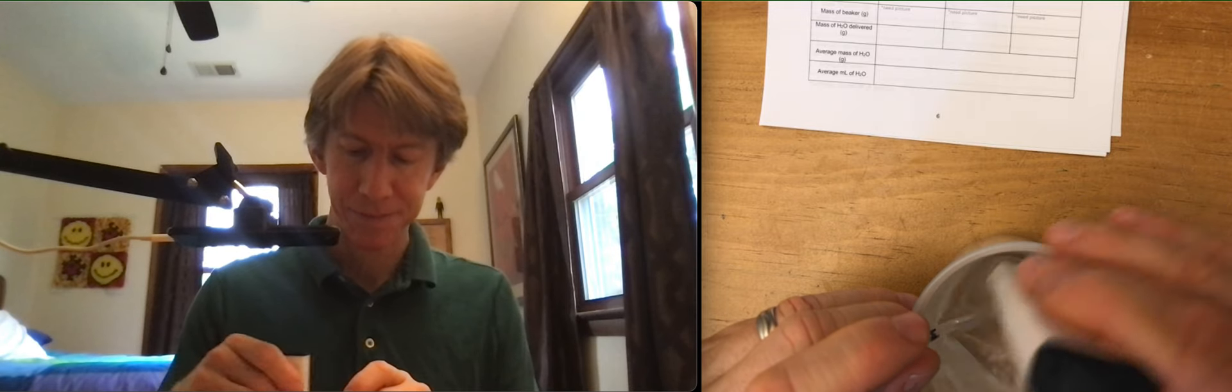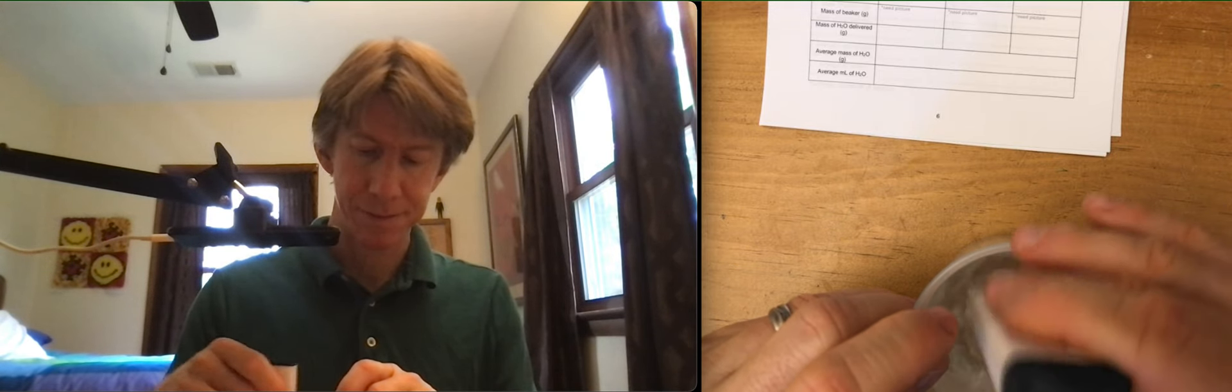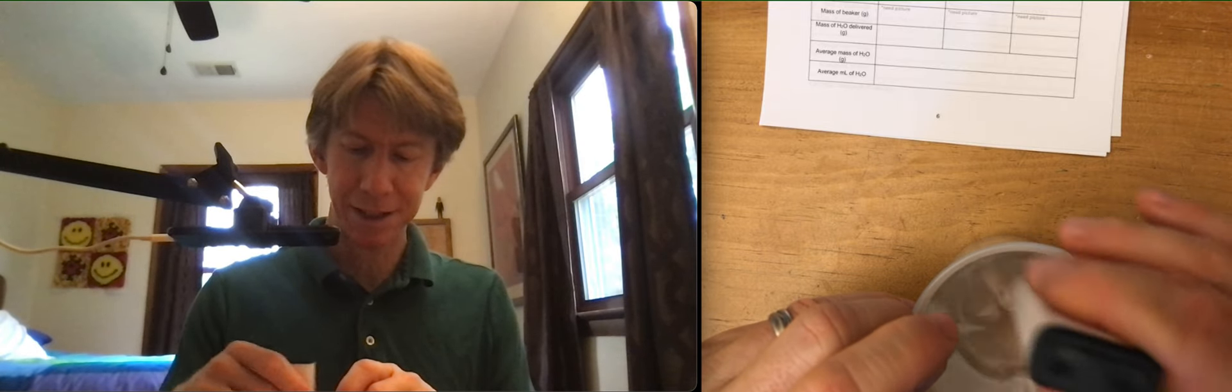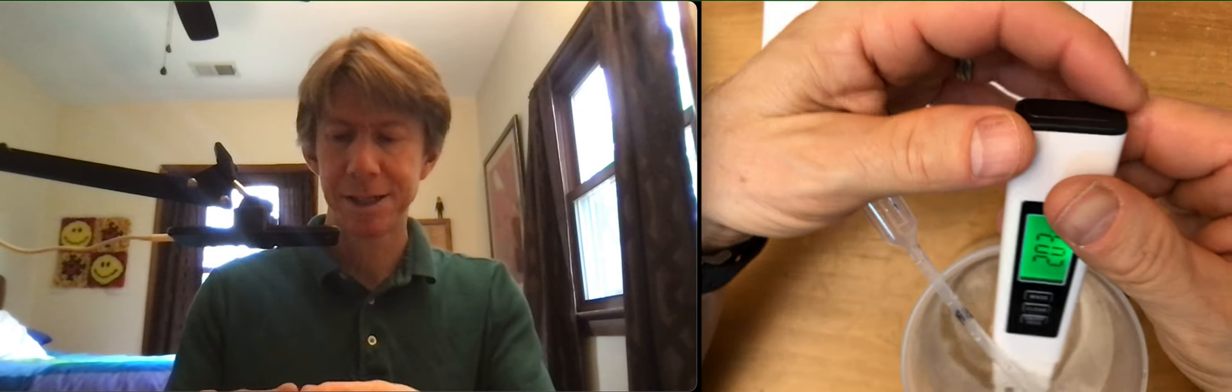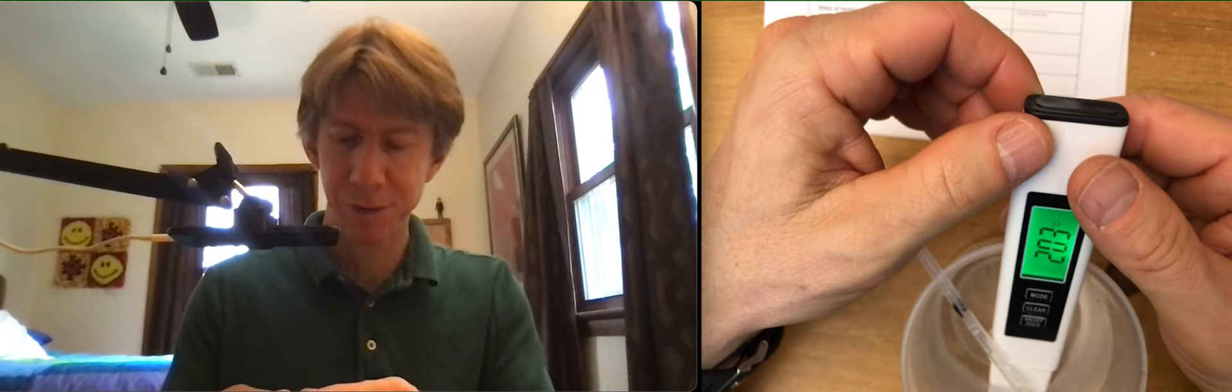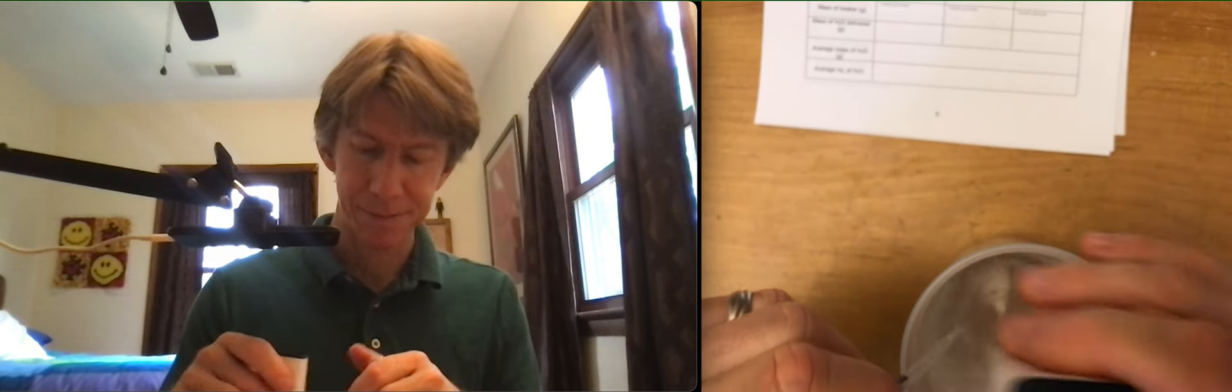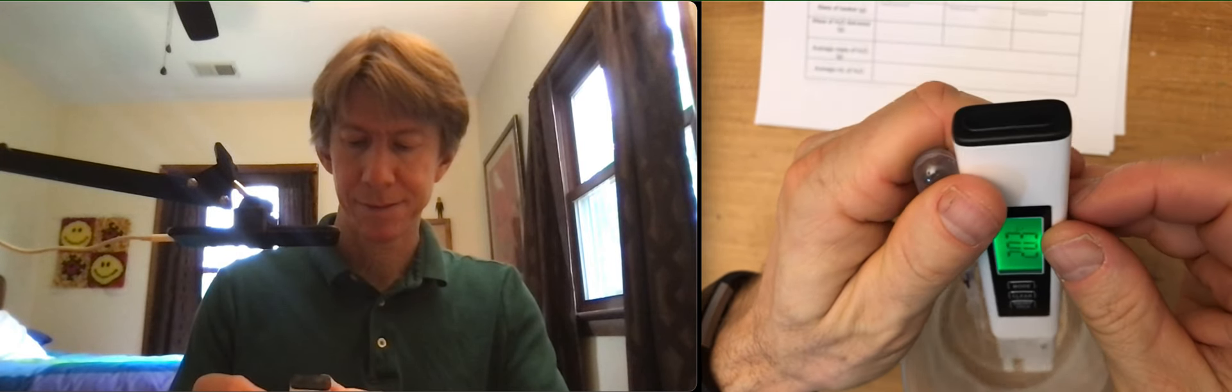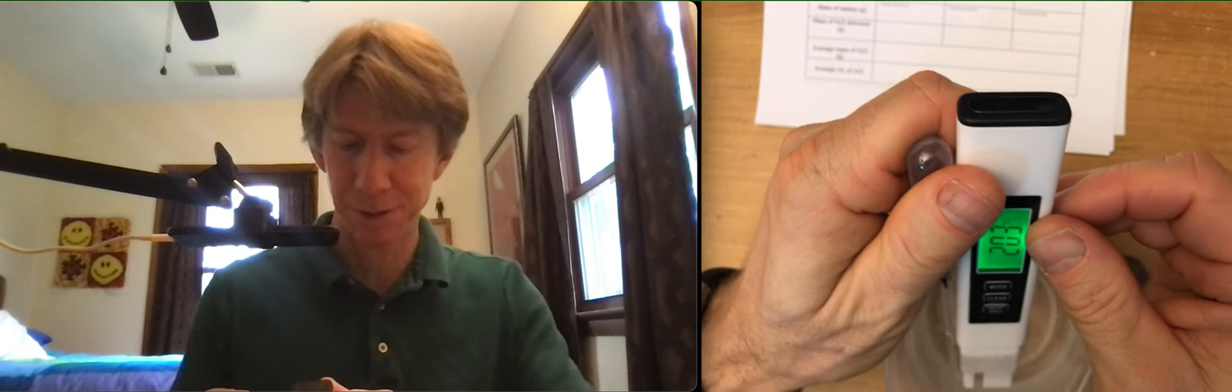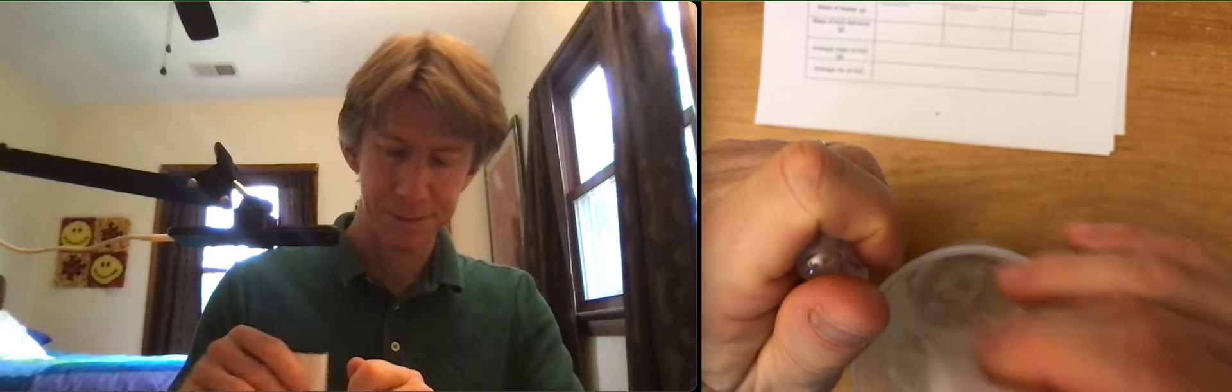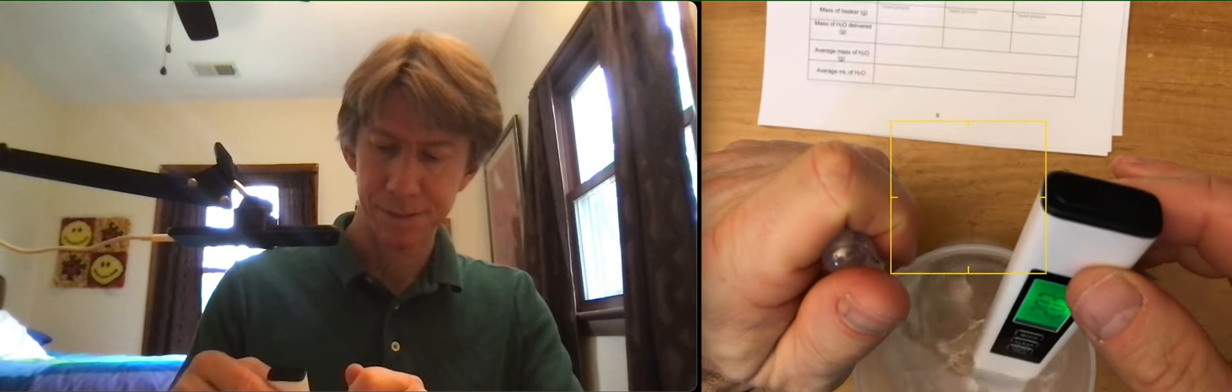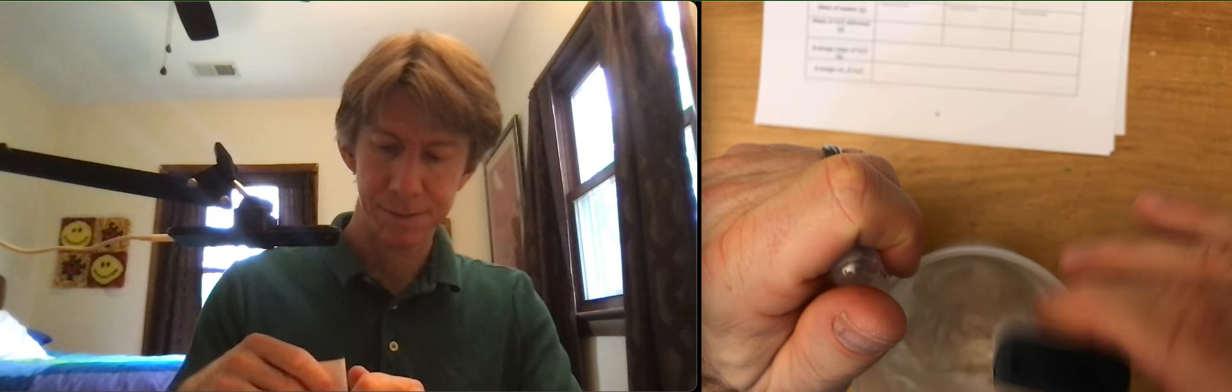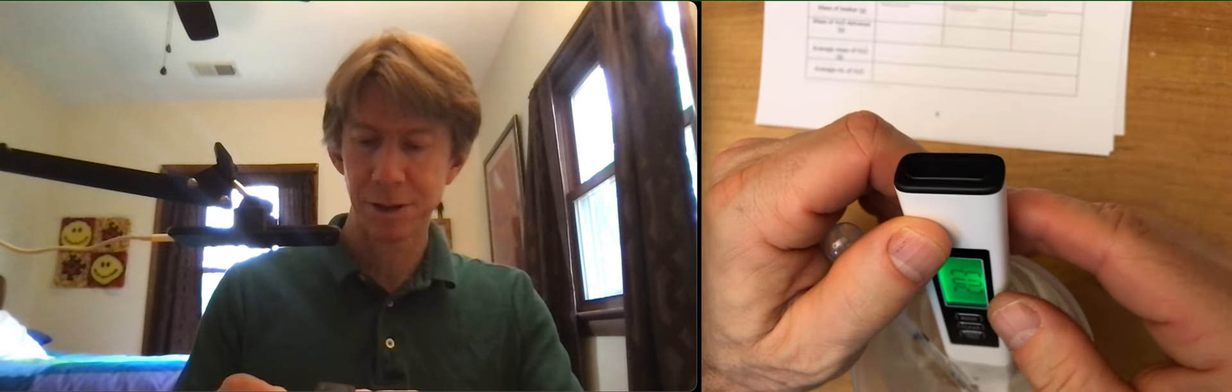But apparently in plastic ware, that's not enough. Let's see, we're at 20.3. Wish there was a pause button, I would pause it. Let's go with 20.3. It's been there a while. Might sneak down to 20.2, but we'll live with it.